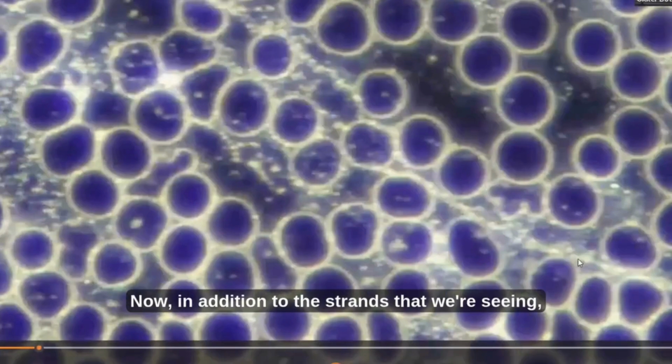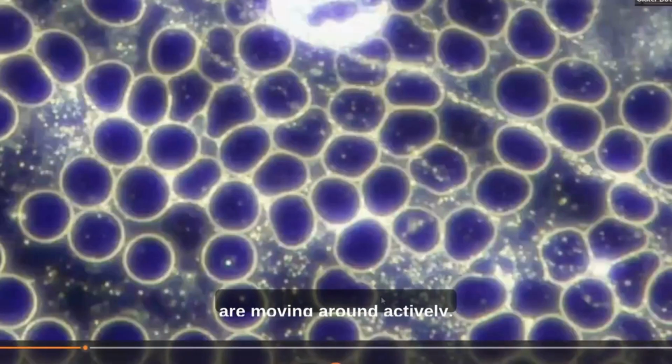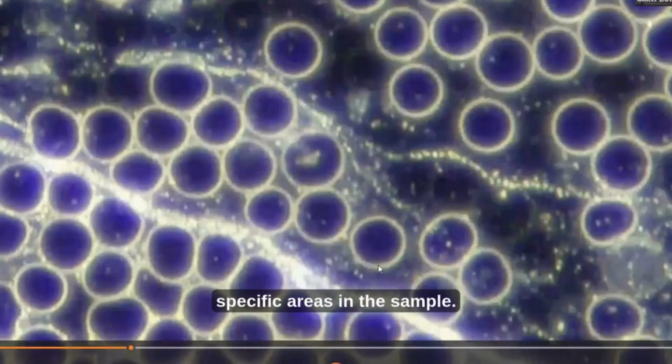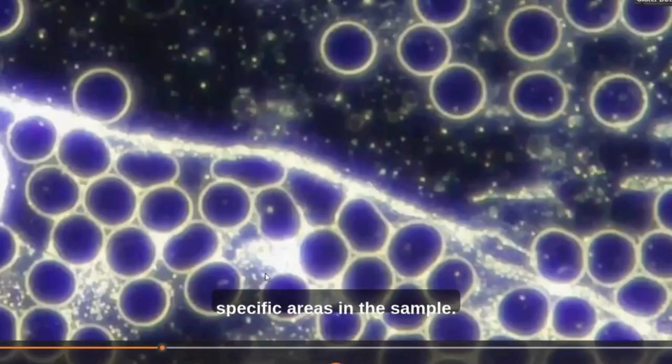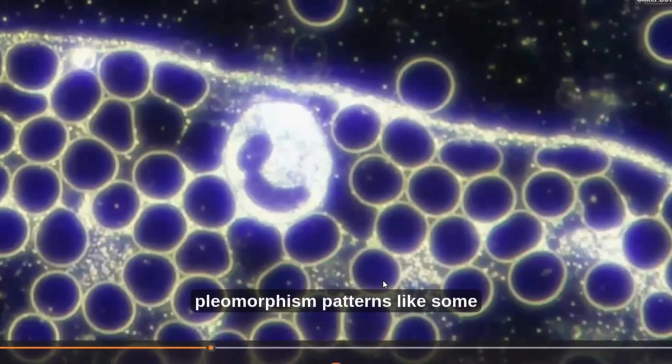Now, in addition to the strands that we're seeing, we're also seeing a high number of these dots that are moving around actively, also concentrated in specific areas in the sample. Now, this is not something that we have seen before in pleomorphism.